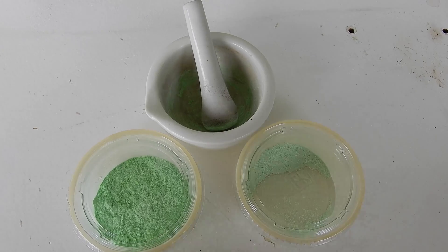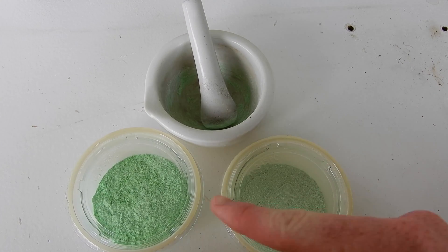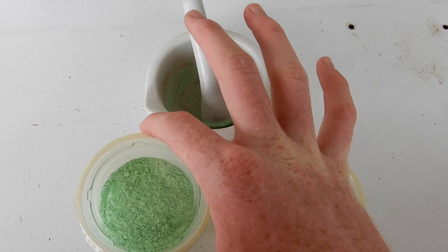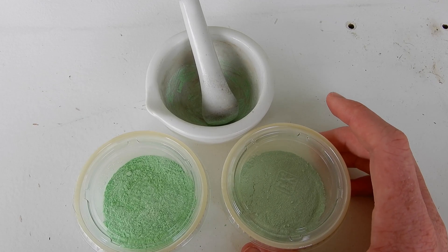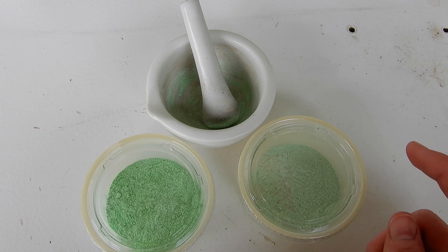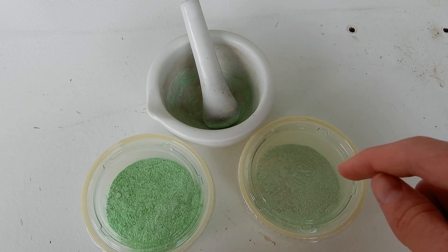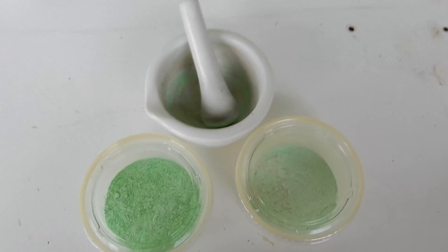I did the best I could and got them as fine as possible. Turns out the one I suspected has nickel sulfate is actually a tad bit brighter. Another source of the brighter green color could be a hydrated form of nickel hydroxide. So what I'm going to do now is combine both of these and heat them in a beaker on my hot plate — that'll turn the nickel hydroxide into nickel oxide and then we'll be able to react it with aluminum.